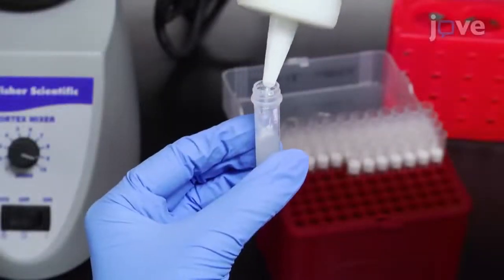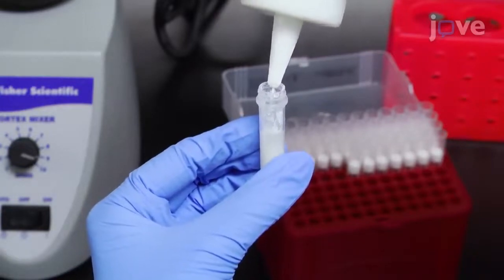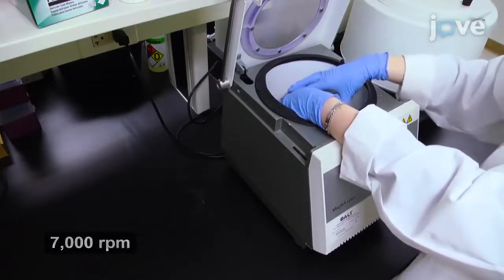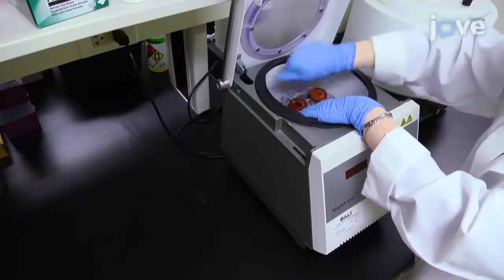Add approximately 800 microliters of 0.1 millimeter zirconia silica beads to the tube. Then disrupt the cells by shaking at maximum speed on a homogenizer for 5 cycles of 30 seconds each, with a 2-minute rest on ice between each cycle.